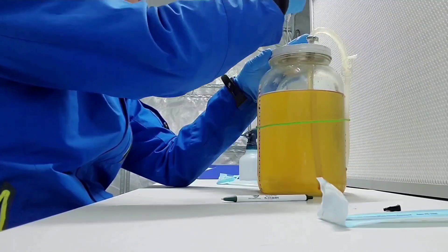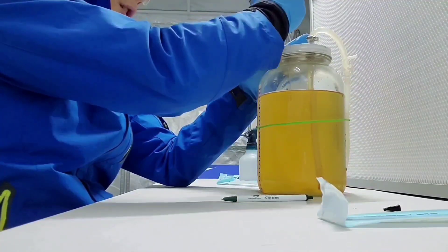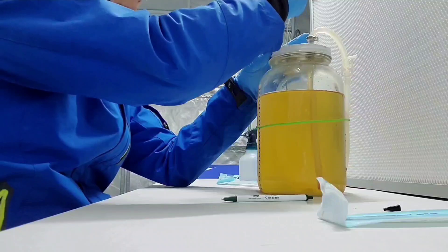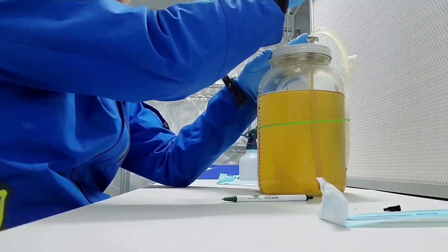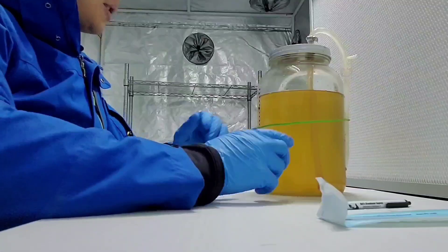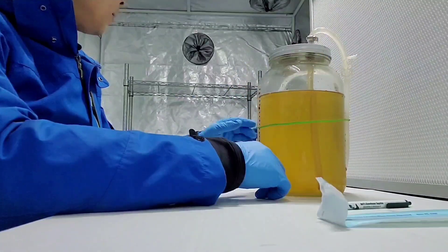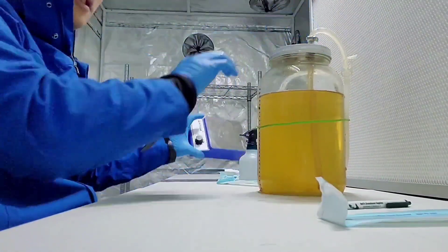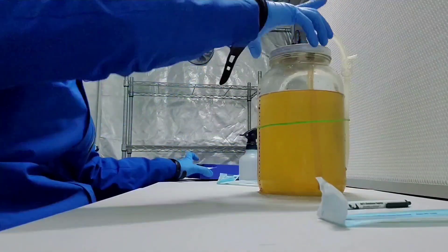Squeeze in. I drew some honey water into the syringe. Squeeze a little bit. I'm going to put this in the jar. I have a stirrer inside the jar.